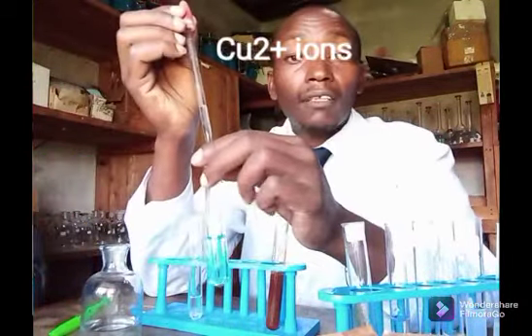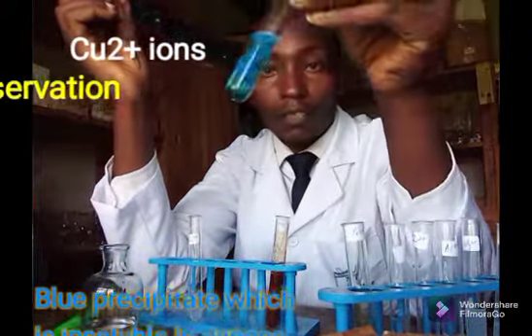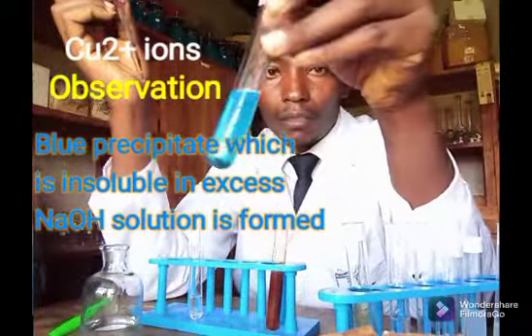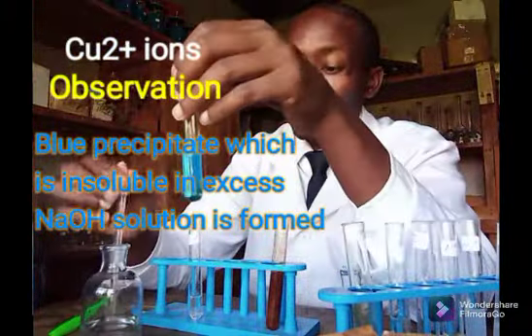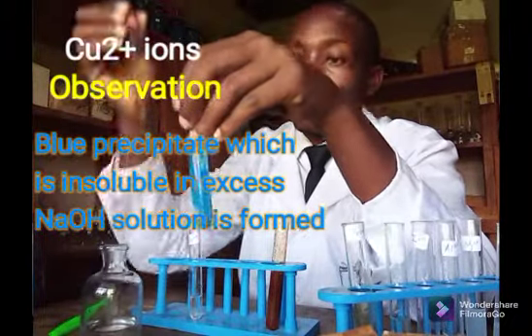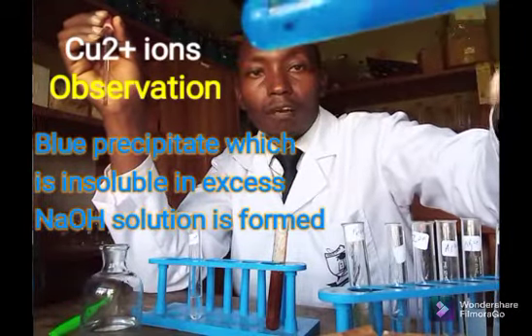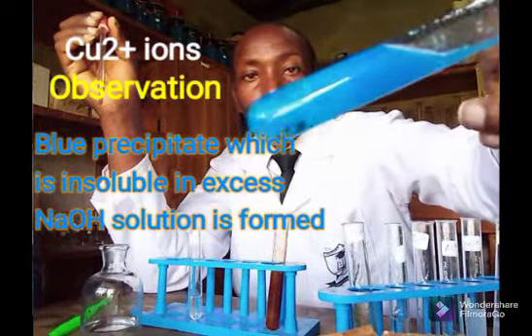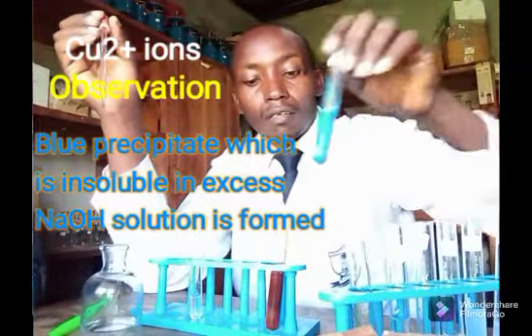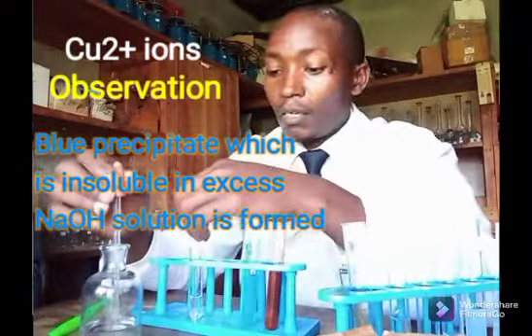So this one has copper-2 ions. Copper-2 ions. So you can see blue precipitate. Blue precipitate has been formed. Even when I add excess of it, you can keenly observe that the blue precipitate persisted. So that is with the copper-2.